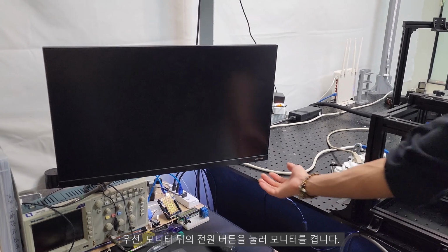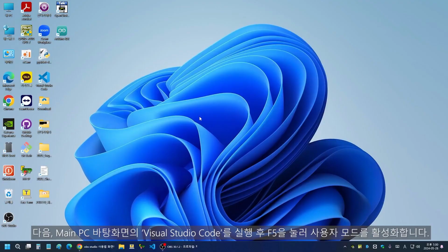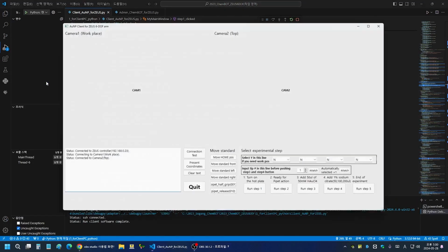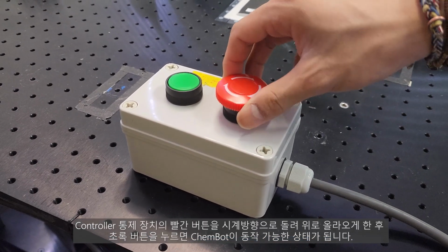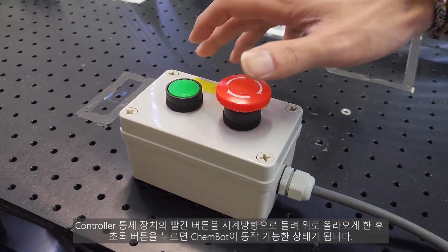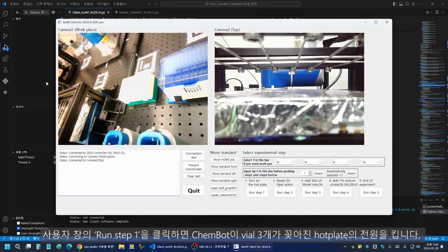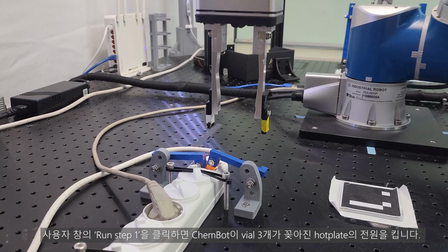First, turn on the monitor by pressing the power button on the back of the monitor. Next, launch Visual Studio Code from the desktop of the main PC and press F5 to activate user mode. Turn the red button on the controller unit clockwise to have it pop up, then press the green button to make ChemBot operational. Click Run Step 1 in the user window and ChemBot will turn on the hot plate with the 3 vials placed on it.